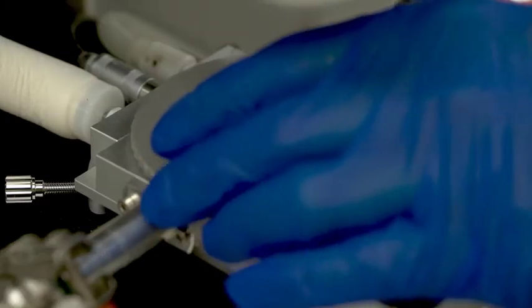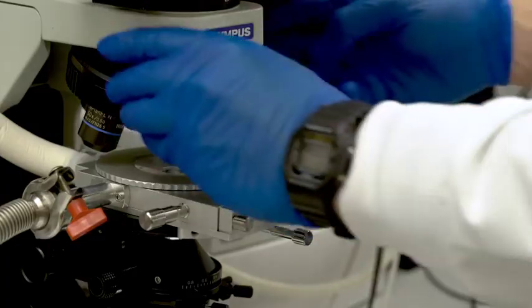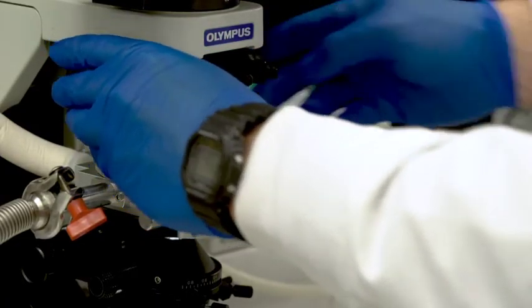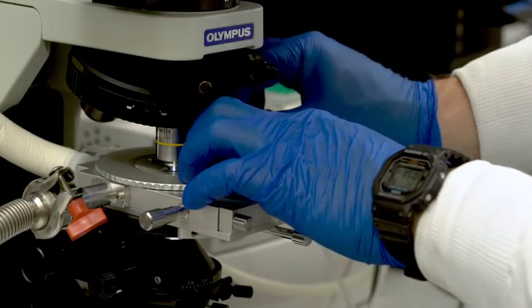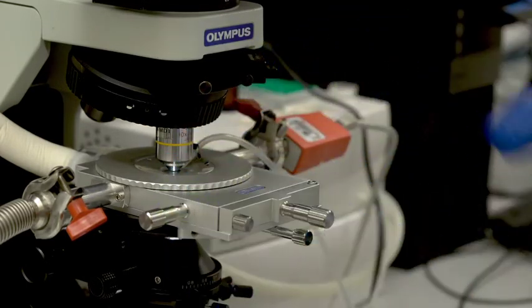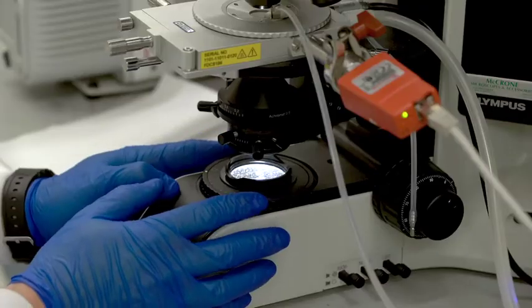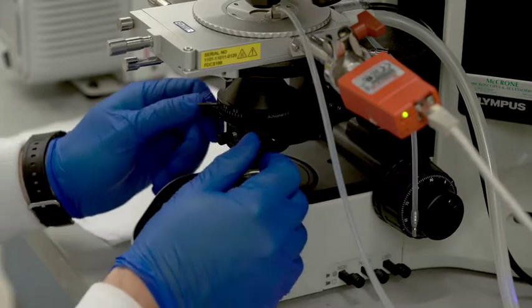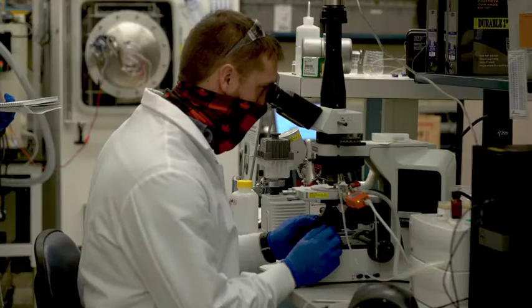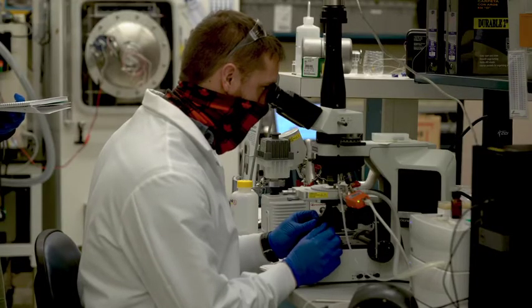Optical train alignment. Move the optical head such that the 20 times objective is selected. Close the aperture on the microscope. Adjust the position of the light source using the optical train adjustment knobs such that it lies at the center of the microscope eyepiece crosshair.